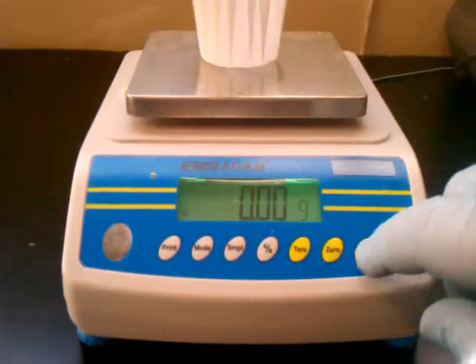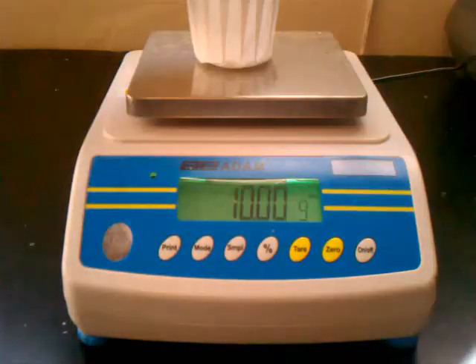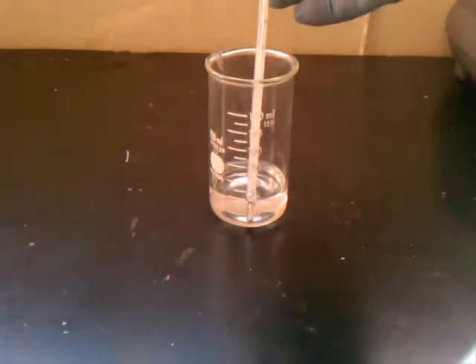We are going to measure out 20 grams of barium hydroxide, 10 grams of ammonium thiocyanate, and also 10 grams of ammonium nitrate. We are going to fill this up to 40 milliliters of water. We are going to take our 10 grams of ammonium nitrate, which is in normal cold packs, and mix it in the water, and measure the temperature with the thermometer. The camera couldn't focus on the thermometer, so I will make sure the numbers are typed on the screen so we can track them.